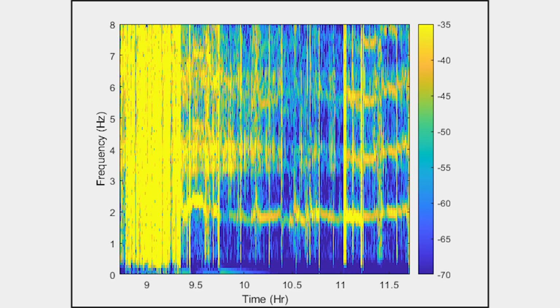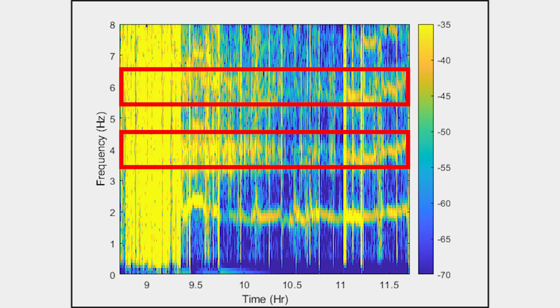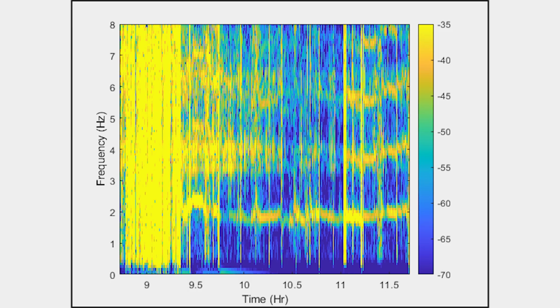Signals created during active times tend to have high signal amplitude and fast transitions that tend to exhibit high energy at all frequencies. While during low activity, the quasi-periodic thorax motion from respiration appears only at the frequency associated with the respiration rate and integer multiples of that frequency. This is observed in the dark blue regions, where a horizontal higher energy band around 2 Hz is observed. There are also bands at 4 and 6 Hz, which are about 2 and 3 times the frequency of the lower band. This pattern seen in the spectrogram indicates good signal quality.